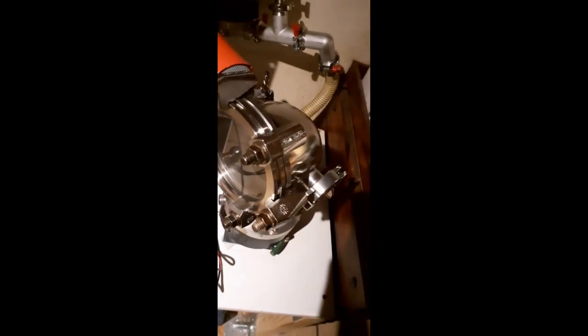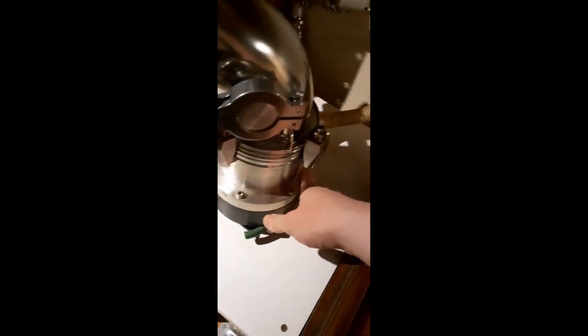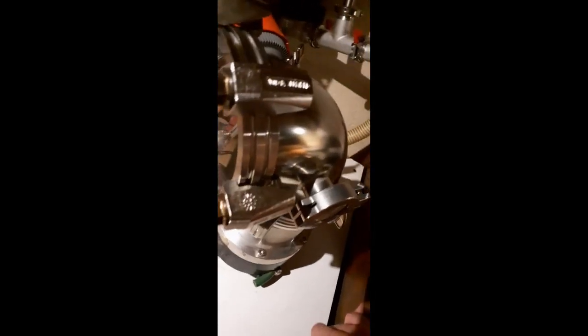Almost a year in the making, but I finally have a functioning, workable high vacuum setup. Let me take you through it. So last time I made an update on this, I had just gotten a turbo pump and some other vacuum hardware, and now it's pretty much done.